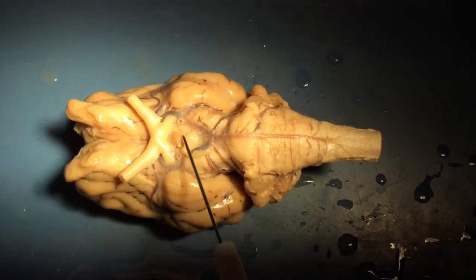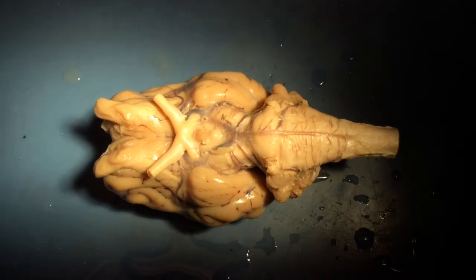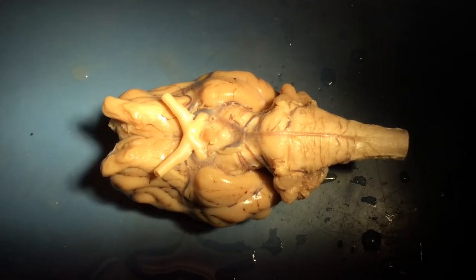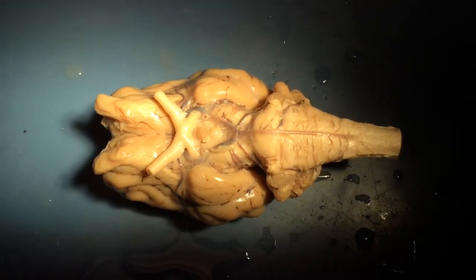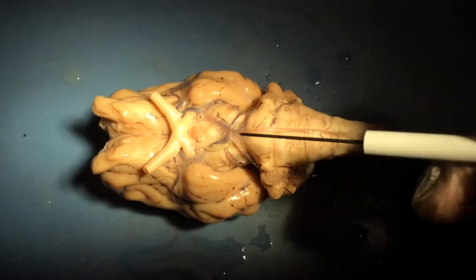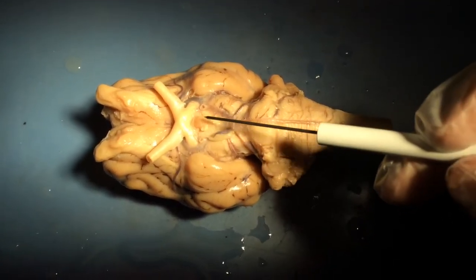Posterior to the optic chiasm, you can see what looks like a slightly pinker or browner colored shape. Whenever you see a brown color, it typically indicates a structure that's got a lot of blood vessels in it. And indeed, this is part of the pituitary gland, which sits just under the hypothalamus and just behind the optic chiasm. So it's part of your endocrine system, but is intimately associated with the central nervous system. Lateral to the pituitary gland, left and right, you can see a couple of prominent blood vessels where they bring the blood supply into the brain.